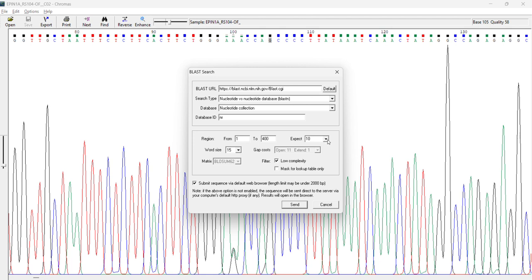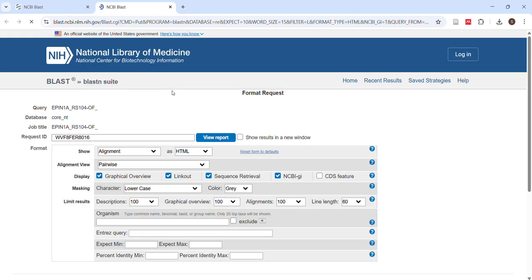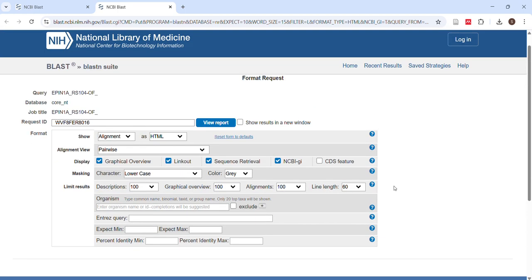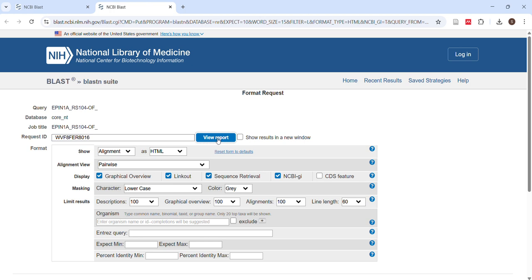Okay, and expect 10 means this is the highest quality ratio. If you go lower, it will be very much precise, so it won't give you proper results. So let it be like that only, and click send. So it will open in NCBI BLAST. We'll see the results. As you can see here, it has shown me one new window. Now what I do here is I click here for view report.